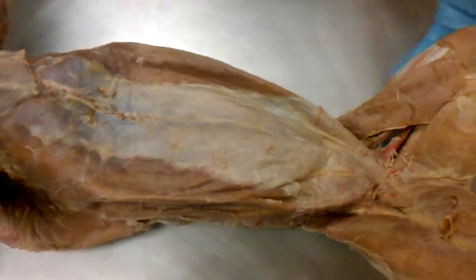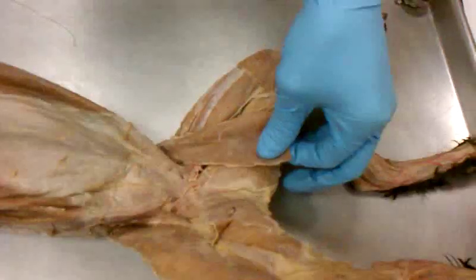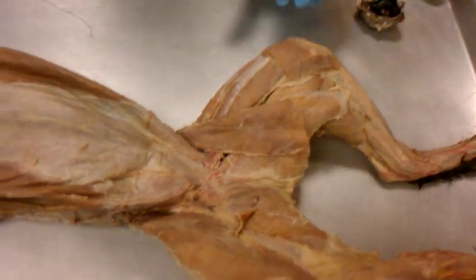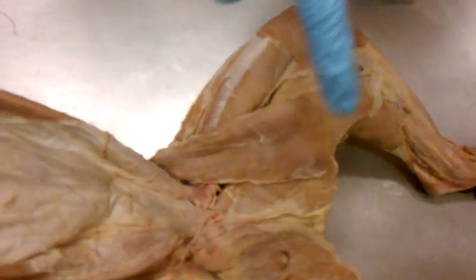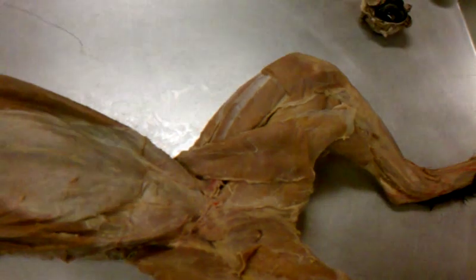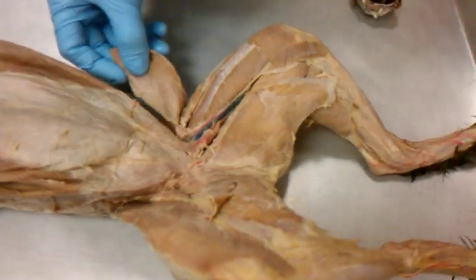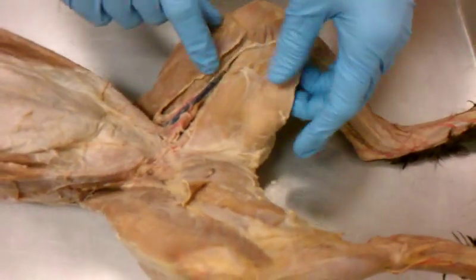At the bottom here, you get into the legs. I told you all to remember the series in which they go, and that should help you. So you have this one that comes around. That's your sartorius. It goes from your hip all the way to the inside of your leg. When it's contracting, it helps your leg go like this. You pull that up, and you have these two right here, which are like your inner thigh. Do you remember what that's called?